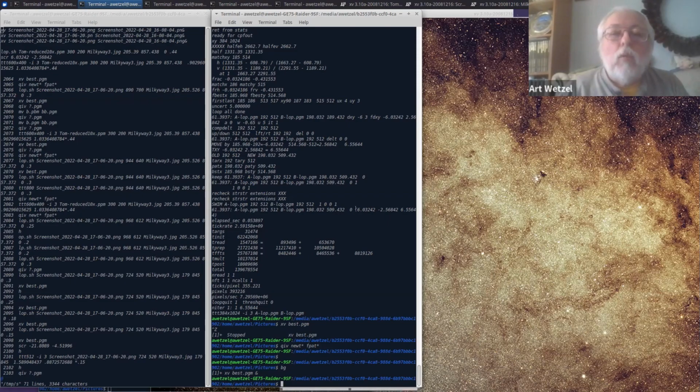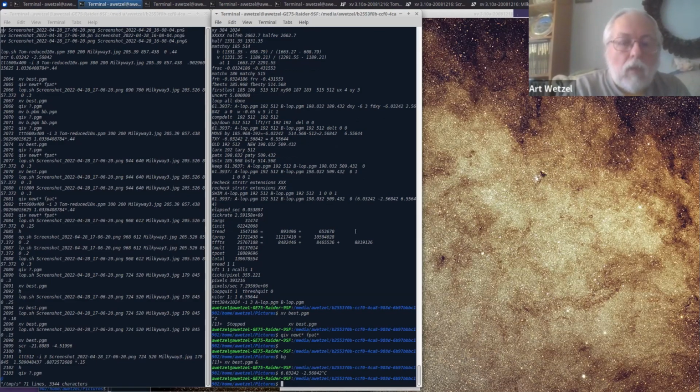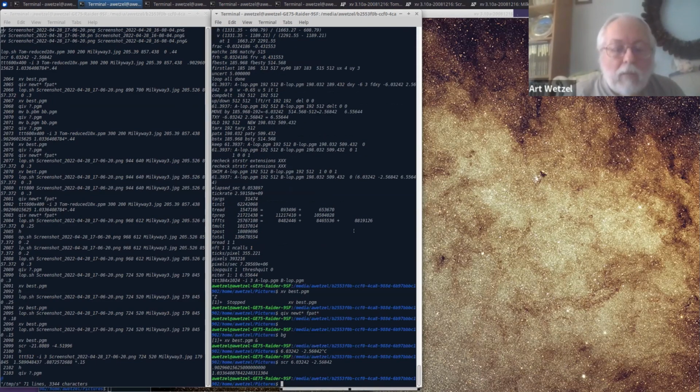So in this case, we get back 2 of those numbers, and I'll just plug them in here to a tiny little program I have that turns these numbers that are offsets in the image that I showed you that had the spot, returns those in terms of an angular measure, in this case 0.902, it doesn't matter what it is, a small sub-degree rotation, and a scale factor here.